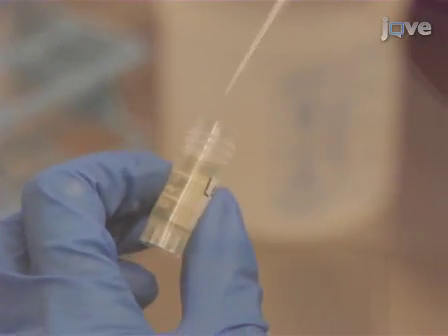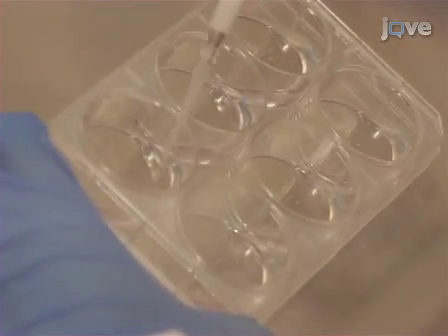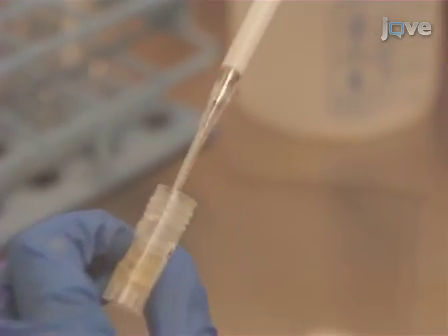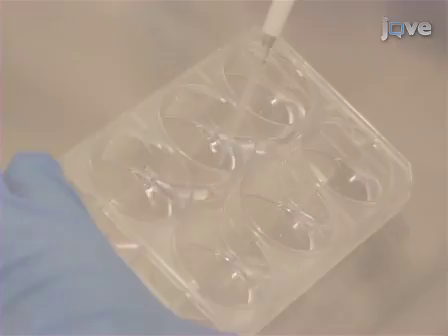Using macrophage cultures, screen the low and high molecular weight fractions for inhibiting activities of late pro-inflammatory mediators such as high mobility group box 1, or HMGB1.